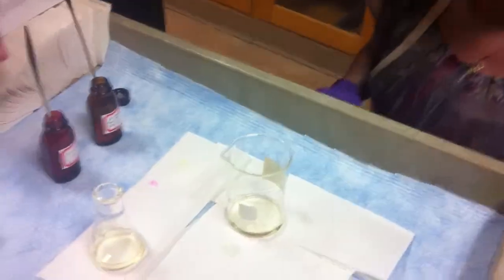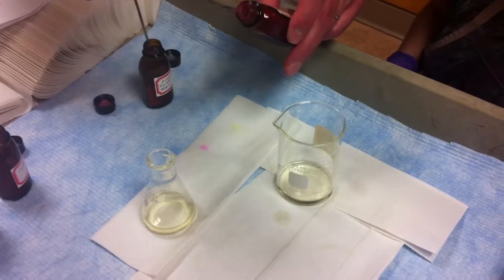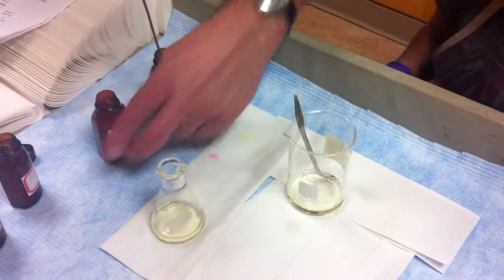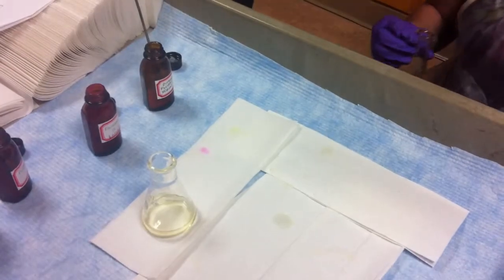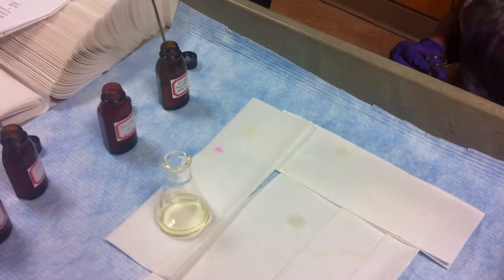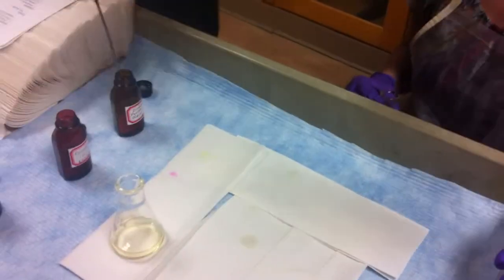Now, let's see. Let's do this one, which is rhodamine B. Can we start mixing colors? No, you don't want to mix colors. That's no fun. Isn't it, though? I was going to say, this is the most entertaining lab we've done so far. Most entertaining lab? You've got to be kidding me.